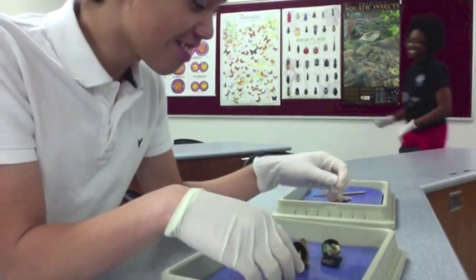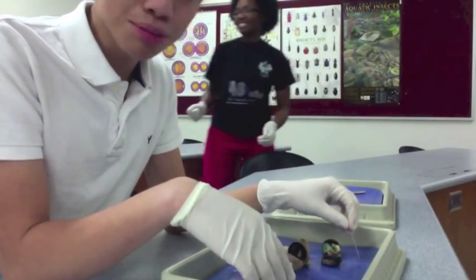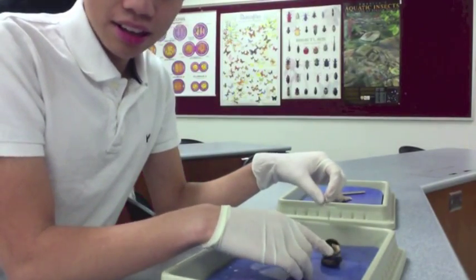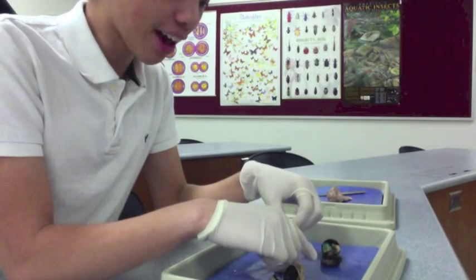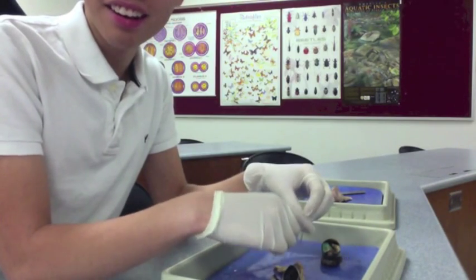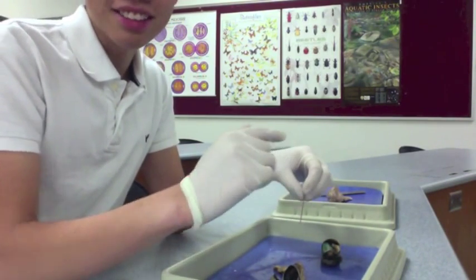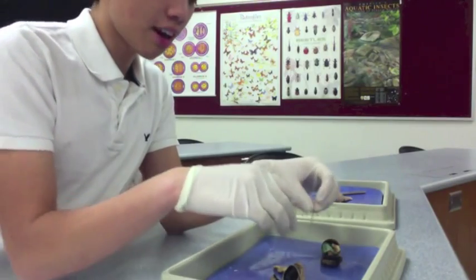Hello, we're going to go over the different dissections. This first one is going to be on the sheep eye dissection. Before that, I forgot to talk about the different layers.